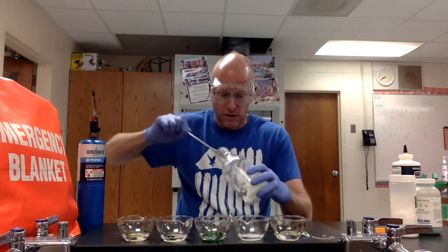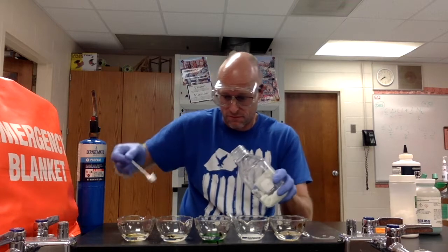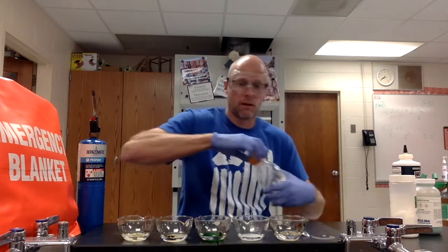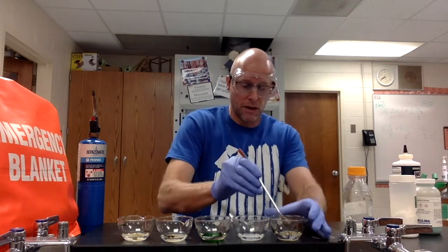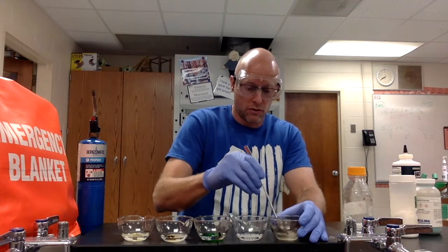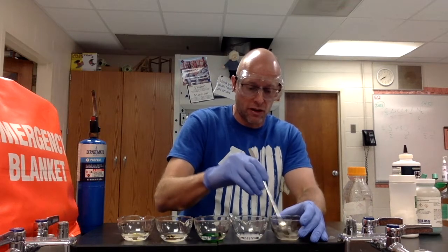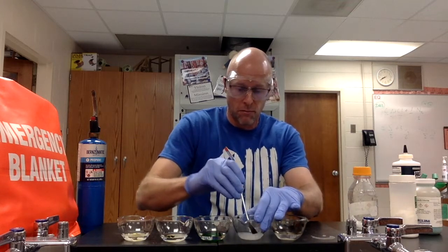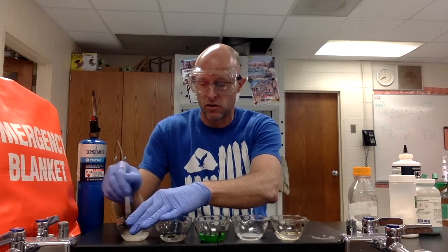Lithium chloride is hygroscopic, which means it absorbs water, so it's a little bit wet — that's just because of the water it's absorbed. I'm just going to stir them up a little bit, making sure I do not mix up these spoons. So there's our sodium chloride solution with methanol, boric acid solution, and lithium chloride solution.